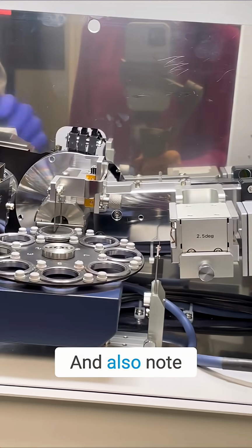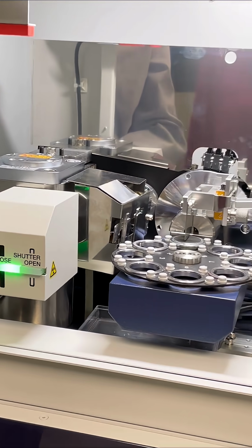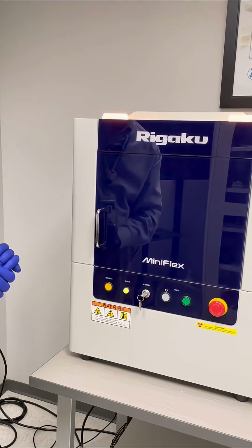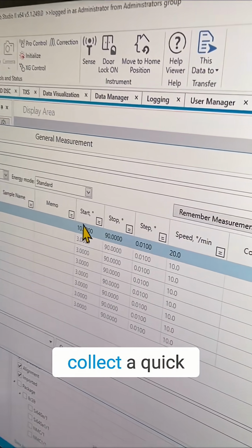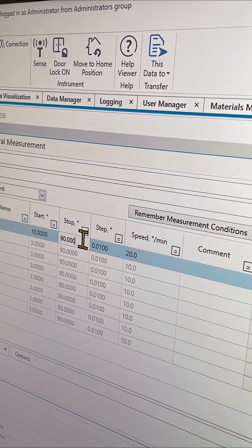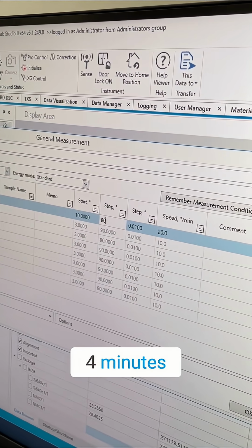And also note there is no K beta filter. So it's a K beta filterless scenario with this detector. With that in mind, we close the MiniFlex, lock the door, and here we are ready to collect the data. I'm going to collect a quick data, 10 to 80 degrees at a speed of 20 degrees, which will take us 4 minutes.